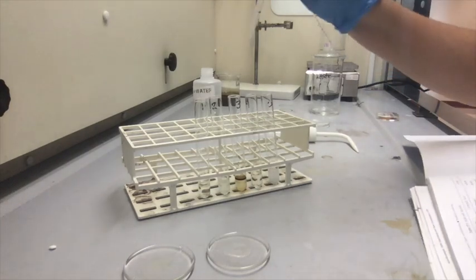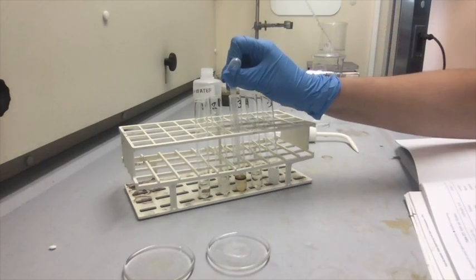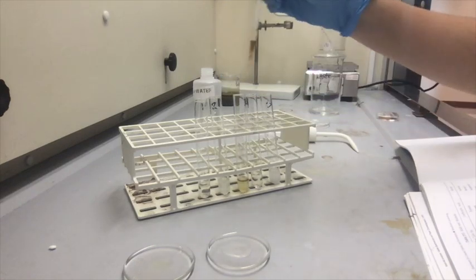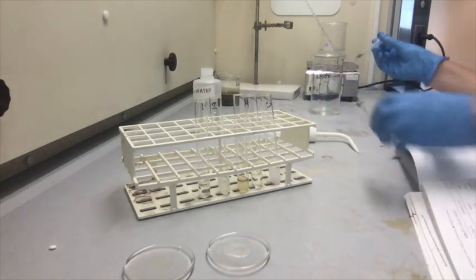Alright, so we're going to go into test tube number 3. And we're going to put it on a watch glass.